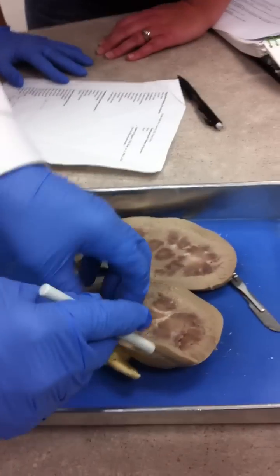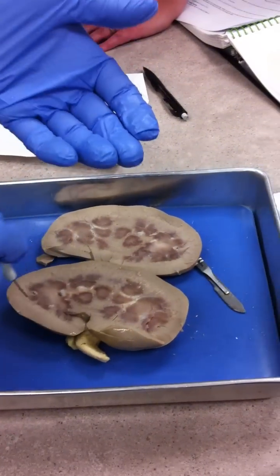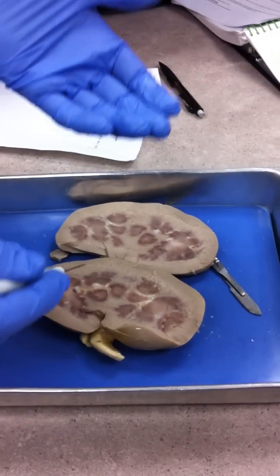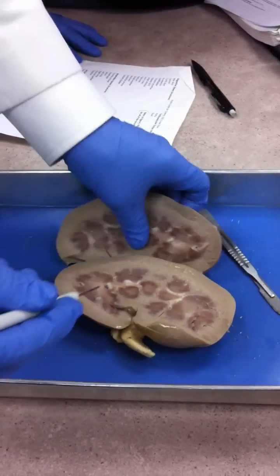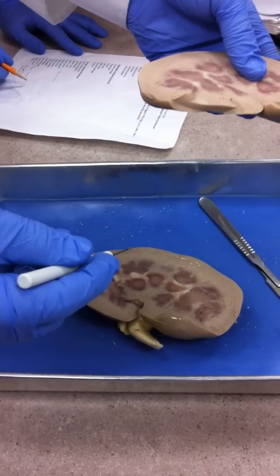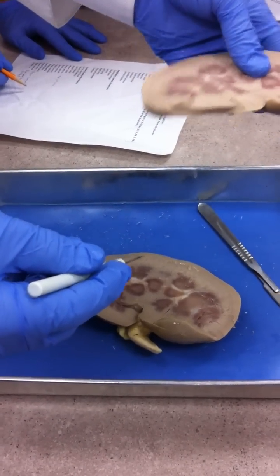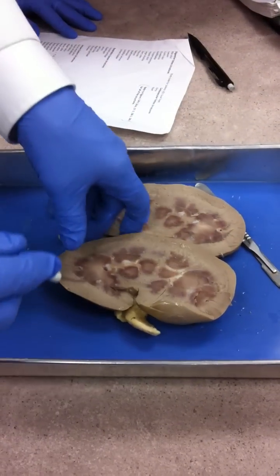Also on your structure list is the right and left kidney. We'll do the pigs in a second — I have to use a pig for that. I can't just throw this kidney out and say, is this the right or left kidney? You won't get it right.